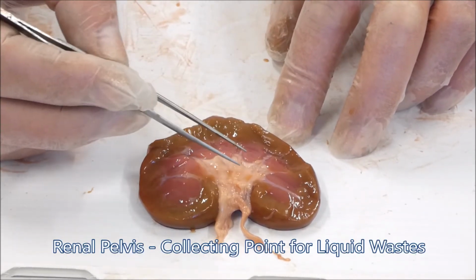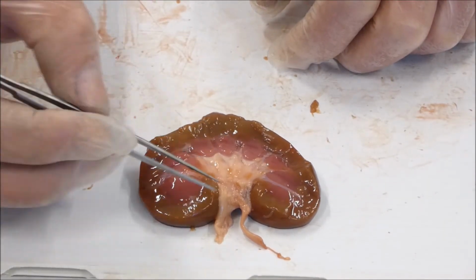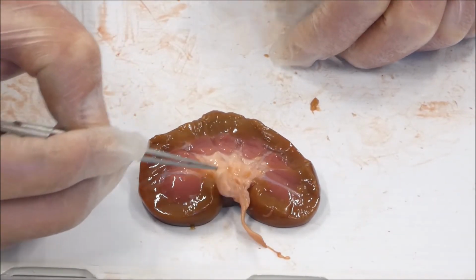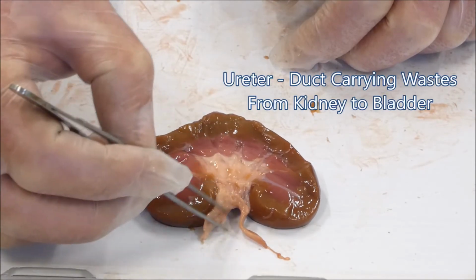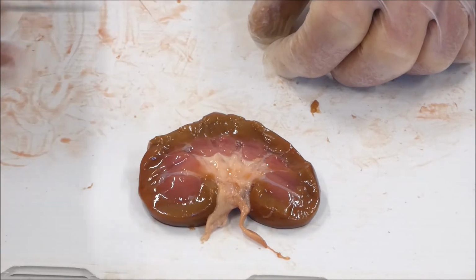The renal pelvis is a collecting area where the waste products are being collected before they go out through a duct here, although you can't see it easily, called the ureter, which goes to the bladder to take the waste products out of the body.